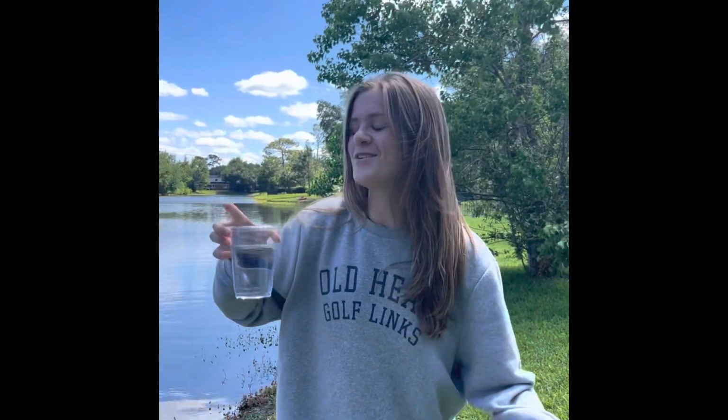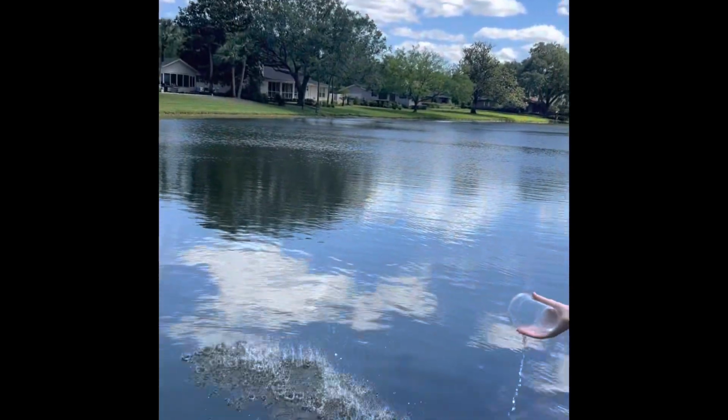This is the perfect amount of base that could be added to the acid to neutralize this leak. Yes, it's neutralized. Thanks for coming along to our experiment. The pond is saved!